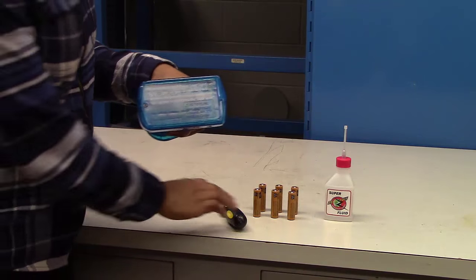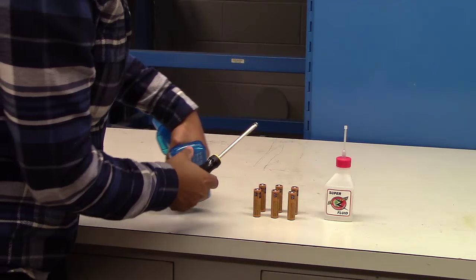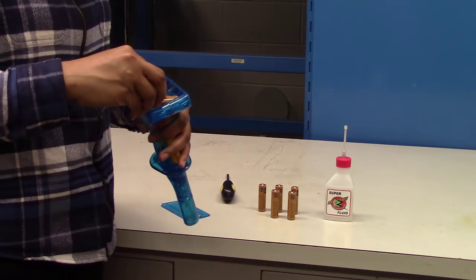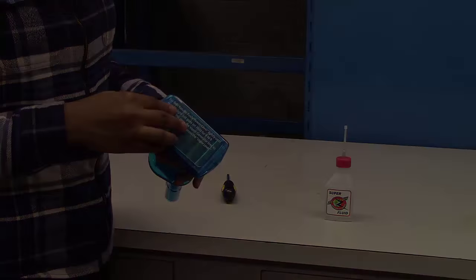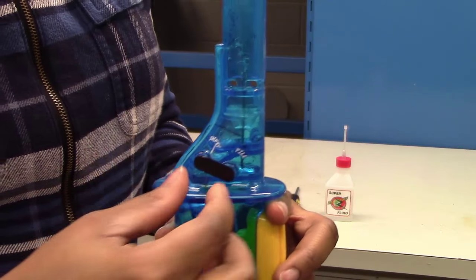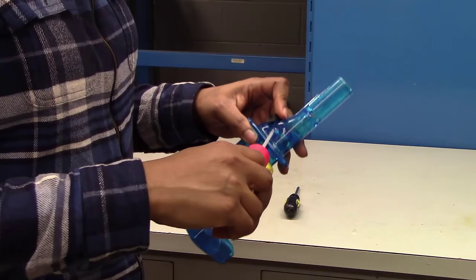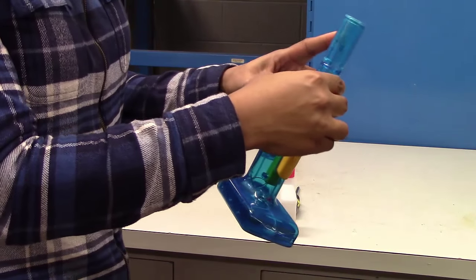To set up the wizard stick, you will need six batteries, a screwdriver and a super zero fog fluid. First, unscrew the battery compartment using the screwdriver and load the six AA batteries. Close the battery compartment. Then, unplug and fill the fluid tank of the wizard stick about three quarters full with the super zero fog fluid. Plug the fluid tank closed.